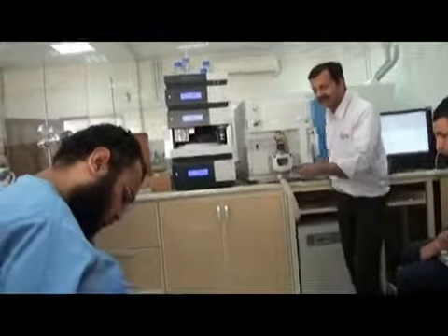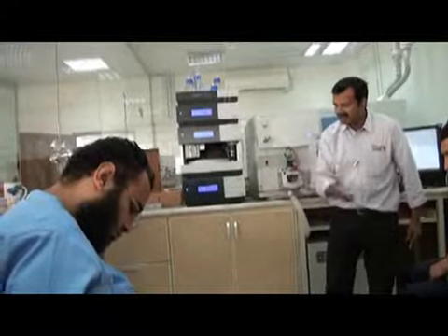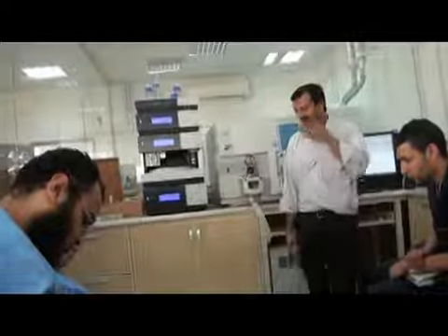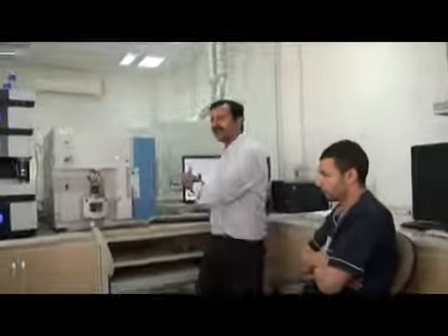Electrospray ionization. And before electrospray you can write heated. So this becomes heated electrospray ionization, short form HESI. H for heated, E for electro, S for spray, I for ionization. Simple. We call it the HESI probe. The only difference is it can be heated to improve the performance.